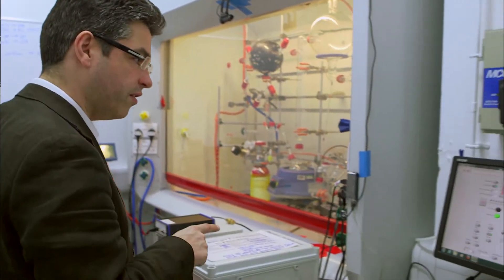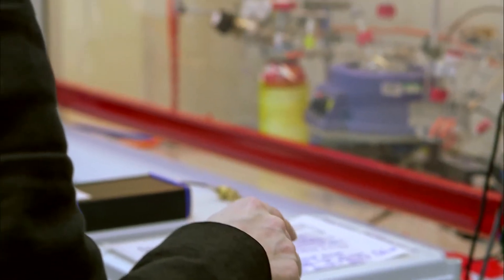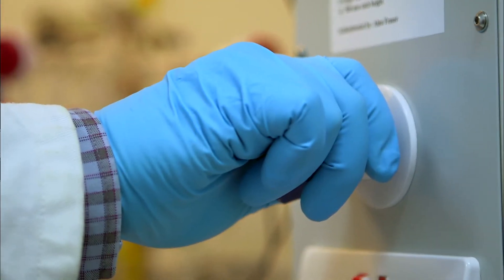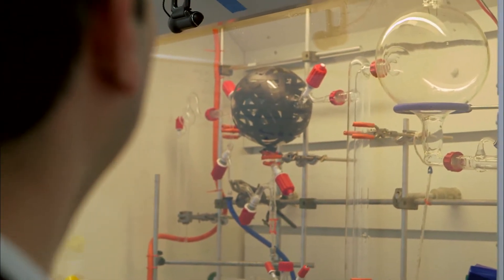All that remains is we need to add the lightning. We're probably going to run out of the room quite fast after we've turned it on because we're not sure what's going to happen. We've got the UV on. Laser, yeah? OK. And the algorithm's all ready? As soon as it's switched to automatic, it will work. All right. Cross-check. One, two, three.